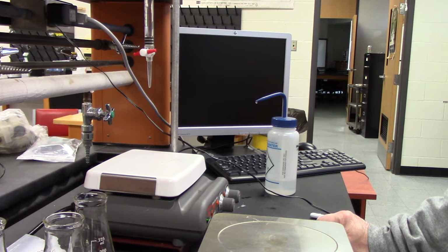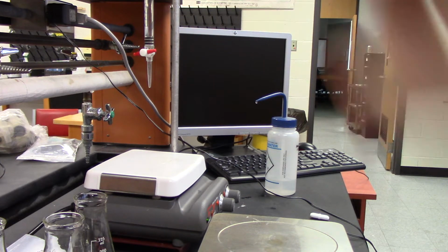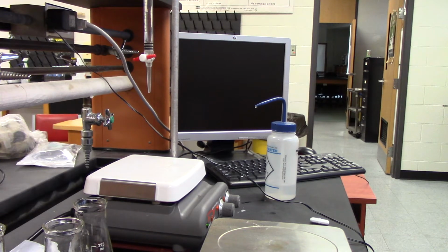So for this one, I'm going to measure out some of my acid, and figure out how much of the acid I have using a standard amount of the sodium hydroxide. We know its concentration. If you know its concentration and you know how many mils it takes to titrate it, volume times molarity is moles, and you can figure out the moles of the base that you use.